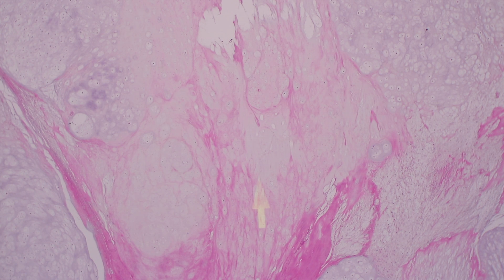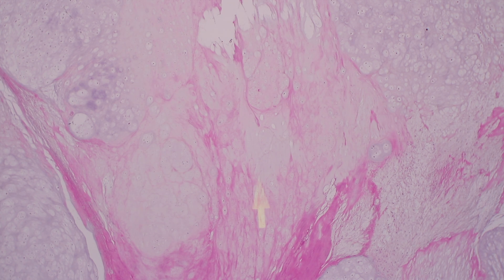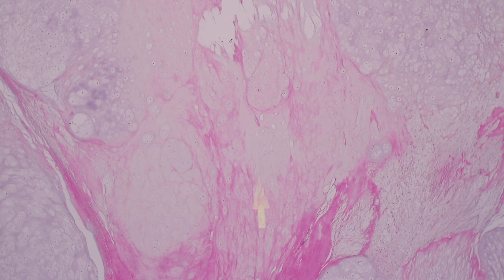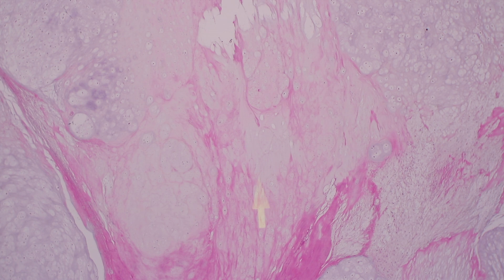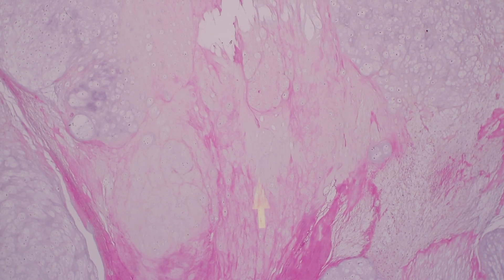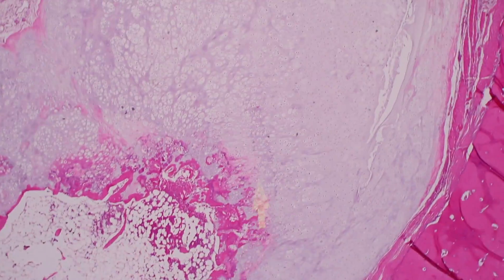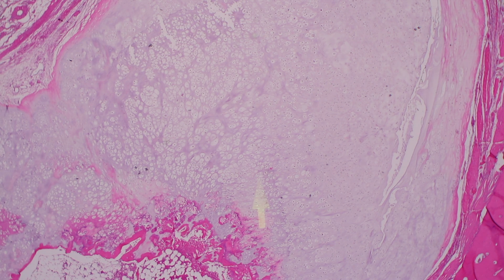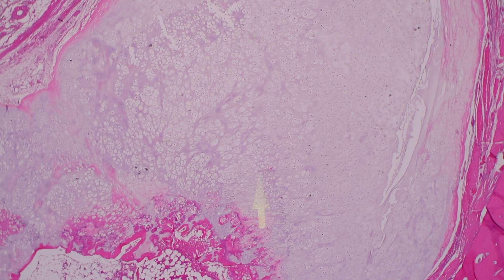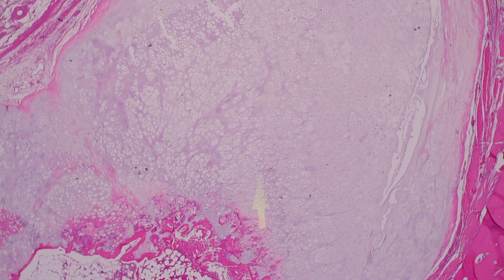The rule of thumb is: the more pure hyaline cartilage you have, the more likely it's going to be a chondrosarcoma. But to use just the thickness of a well-formed cartilaginous cap — say two centimeters — I don't say that if it's two and a half centimeters, by definition it's a chondrosarcoma. You should have lobular expansion into the soft tissue, although sometimes it can be hard depending on your section to see where the osteochondroma ends and the chondrosarcoma begins. That's why I like to look at my own gross specimens and be involved in taking the sections in the plane I want, to minimize confusion.